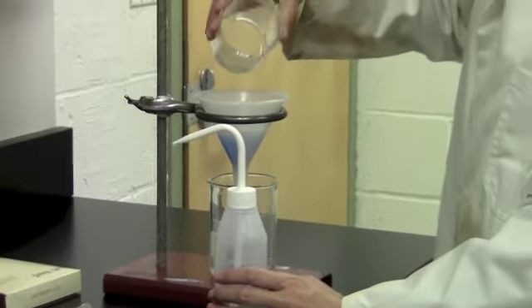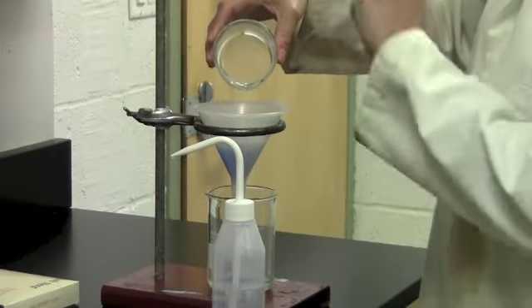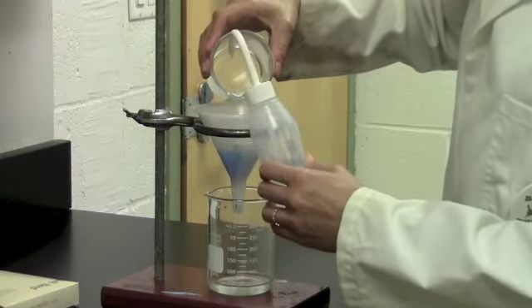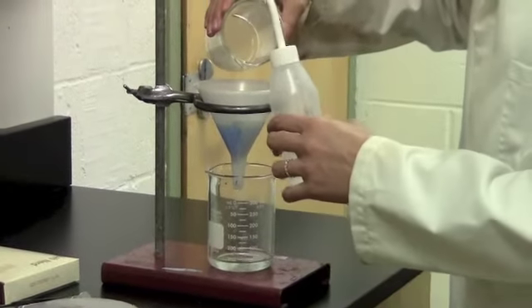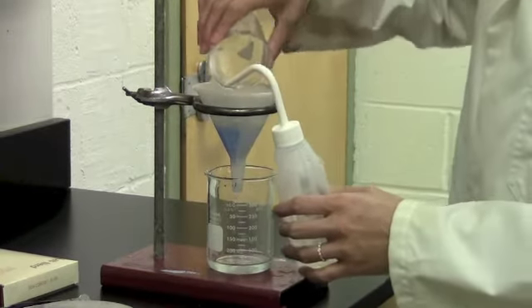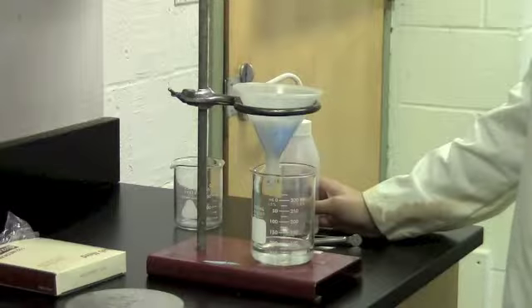Once you've poured out everything from your beaker, you might see that there's still a little bit of solid stuck in there. Remember, that's the product you want, so you need to get that into your filter paper somehow. You can use a squirt bottle to rinse it down in. Again, all the liquid is going to go right into the beaker, so you can add as much water as you want without affecting your product. Of course, the more water you add, the longer it will take. But you want to make sure you rinse until all of the solid is out of the beaker.